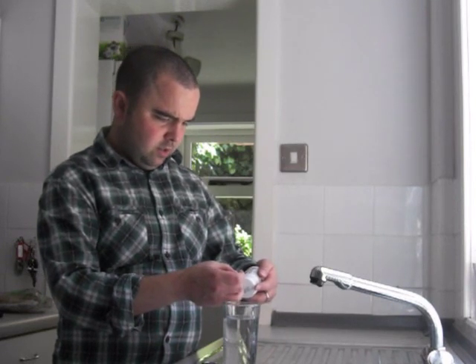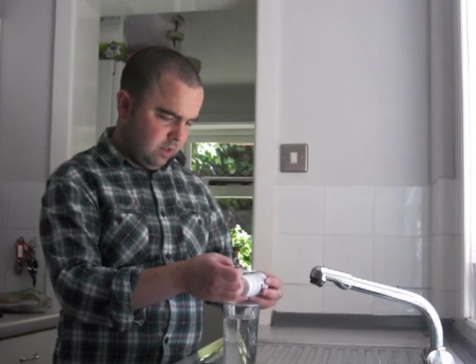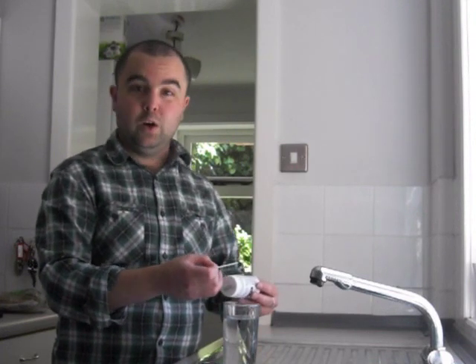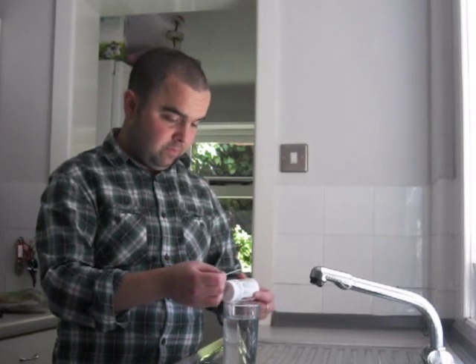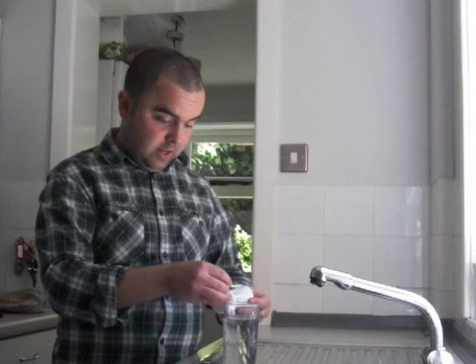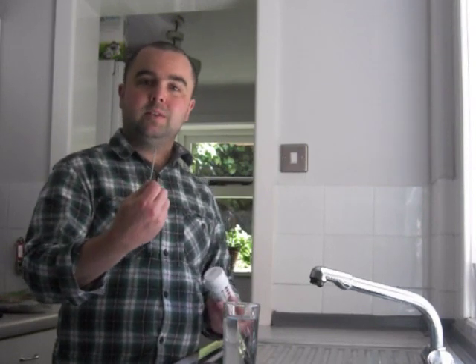The total hardness of the water here is about 120 ppm, which is fairly low, and just shows that in this area the hardness is fairly low. The pH of the water in this area is about 7.6, which is about right — just above neutral. So just by doing that simple test strip you can easily find out the hardness and pH in a simple two-minute test.